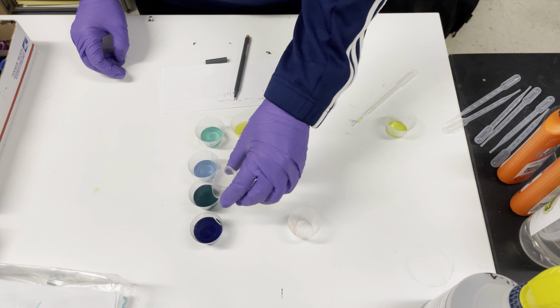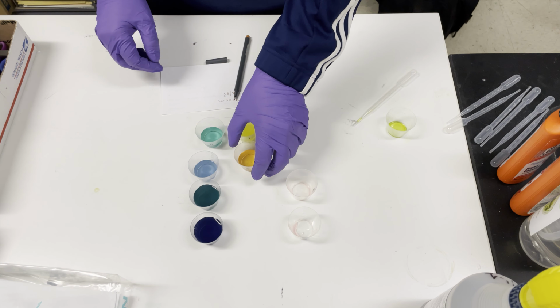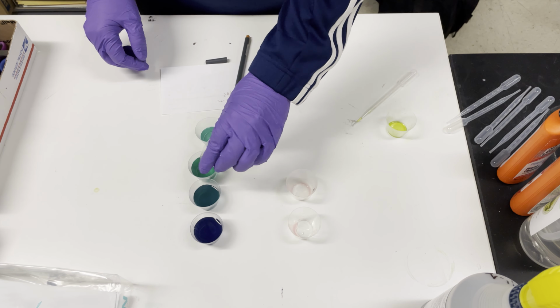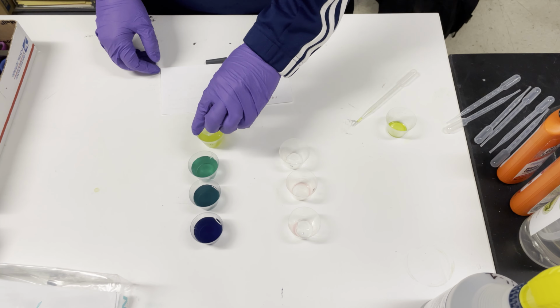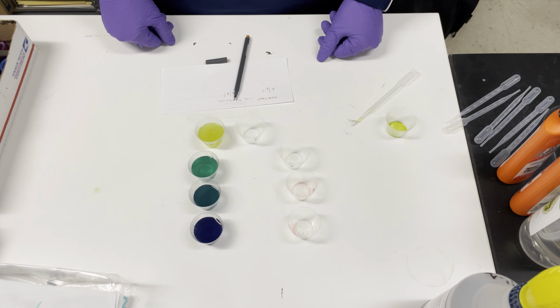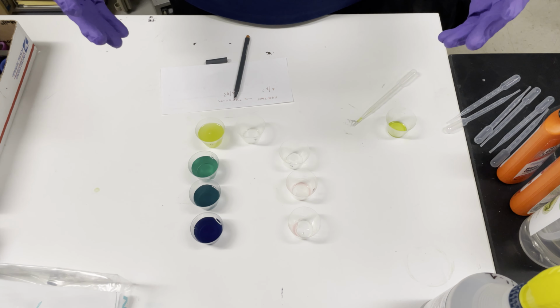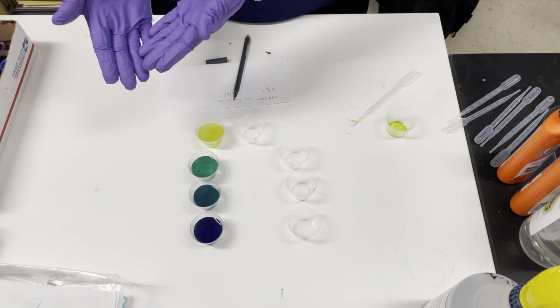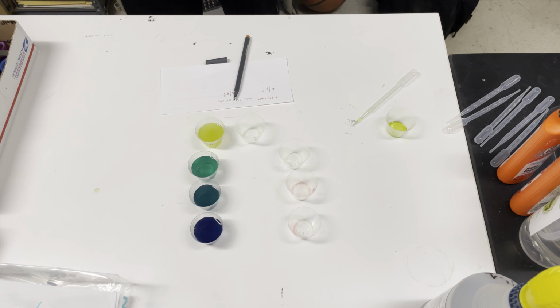Always add acid to base. In this case, they were about the same. They became neutral. 4 into 5. Once again, neutral. And if I add a little weak acid to a neutral substance, it indeed becomes acid. So we can go over how you can determine whether the product will be acidic or basic based on the acidity or alkalinity of the reactants.